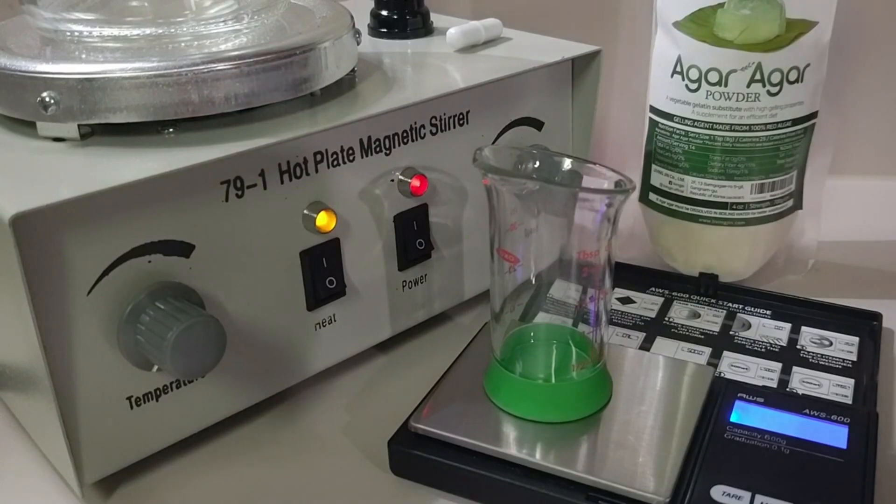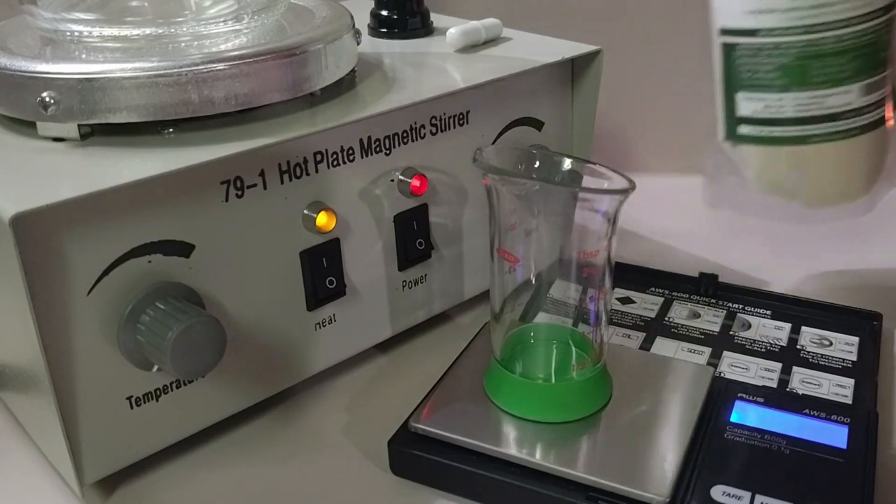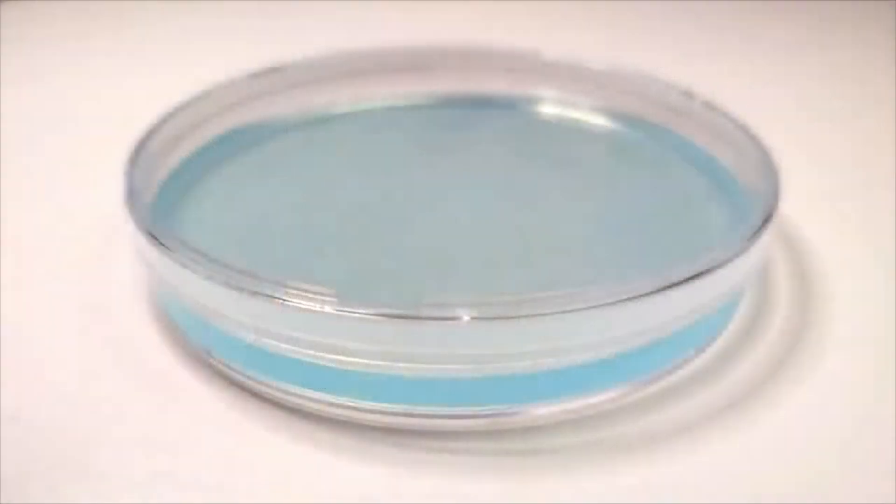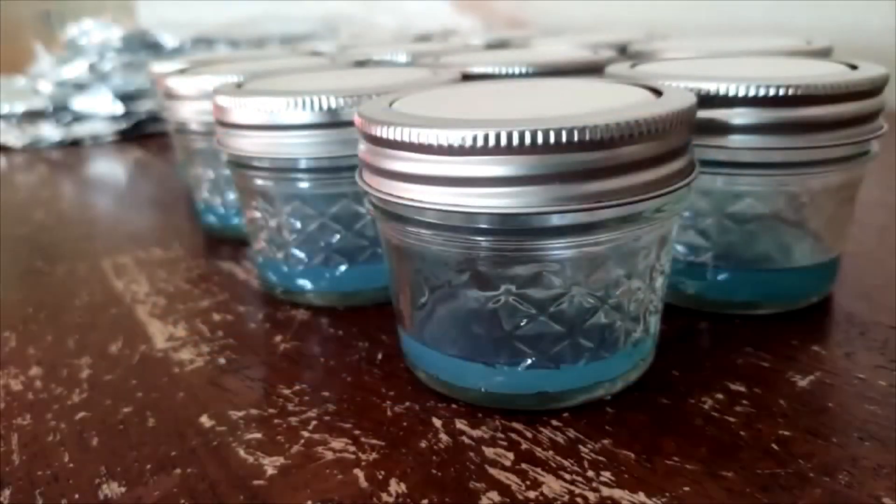It allows the mycelium the time to stretch and find nutrients. Spores are inherently dirty, so utilizing agar techniques allow the home mycologist to clean out any contamination before moving on to the next step of grain spawning.